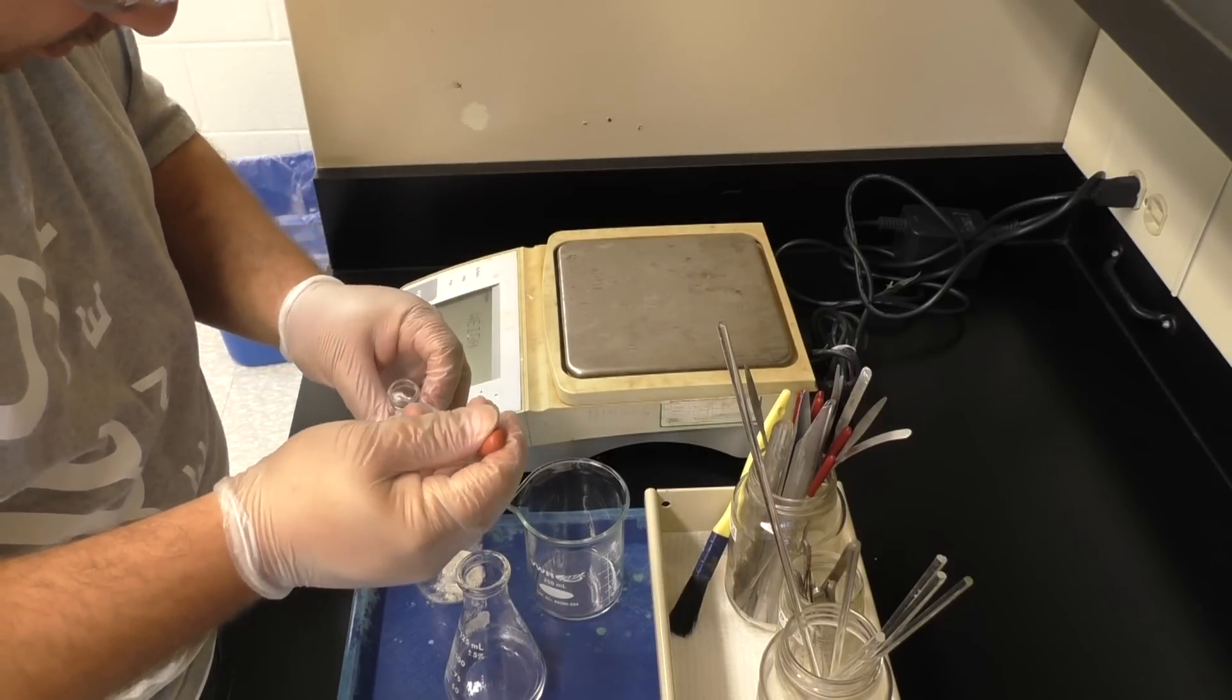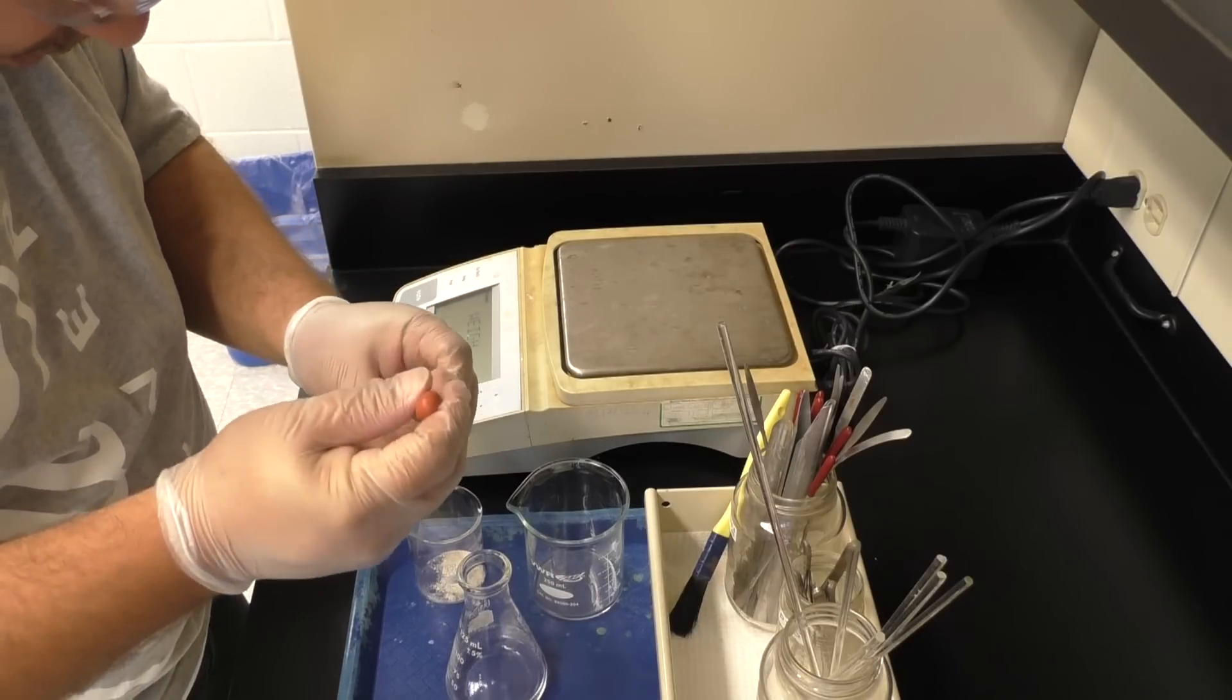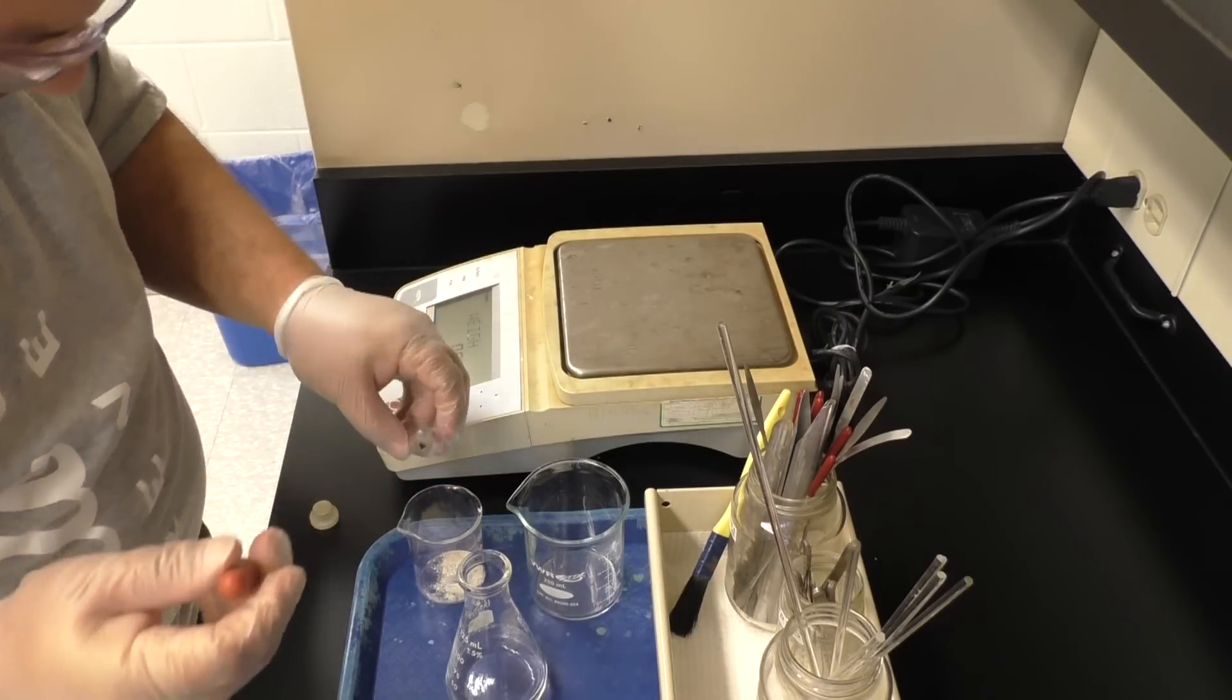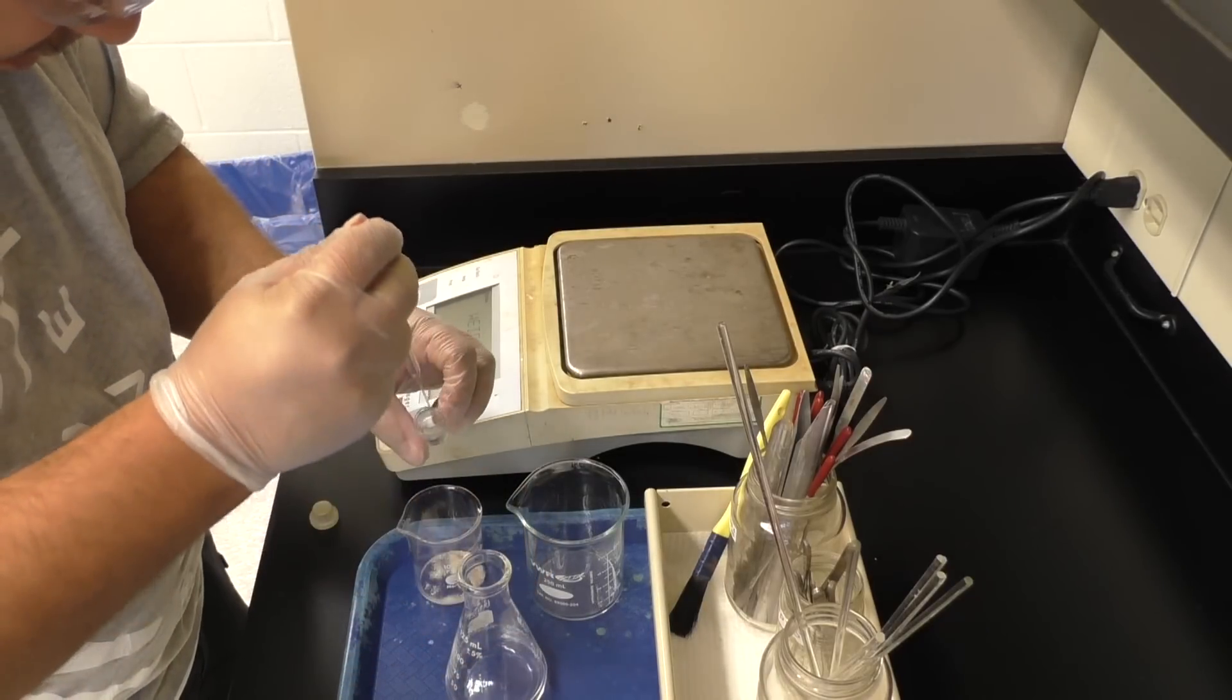you're going to go and get some ether, and that first time you take ether into the pipette, it might immediately squirt out, so be sure you don't go too far with it.